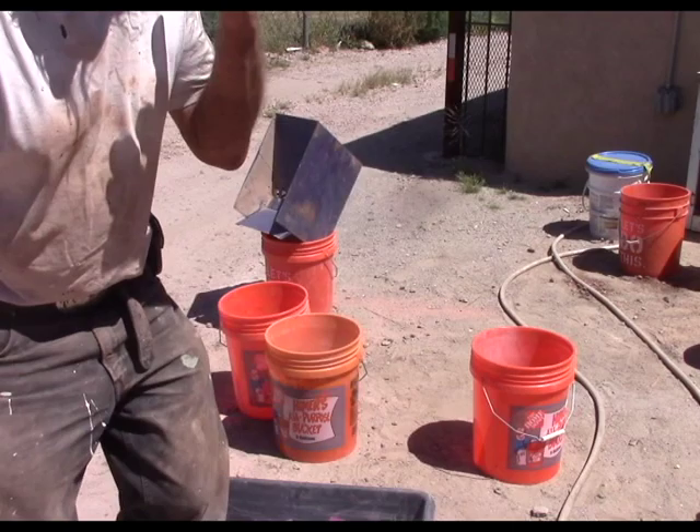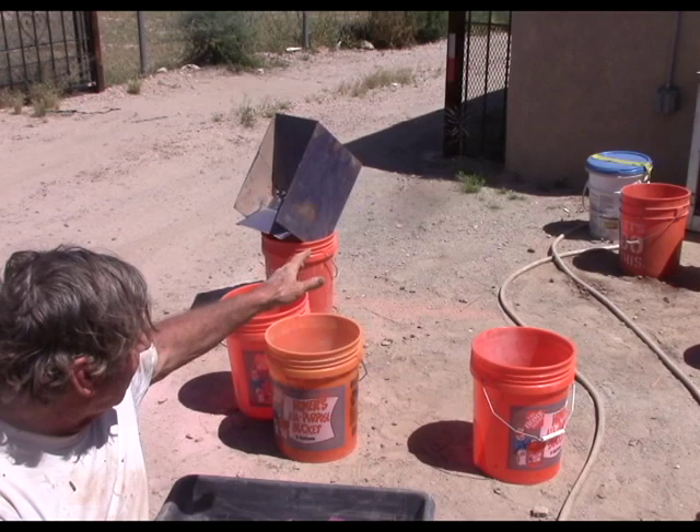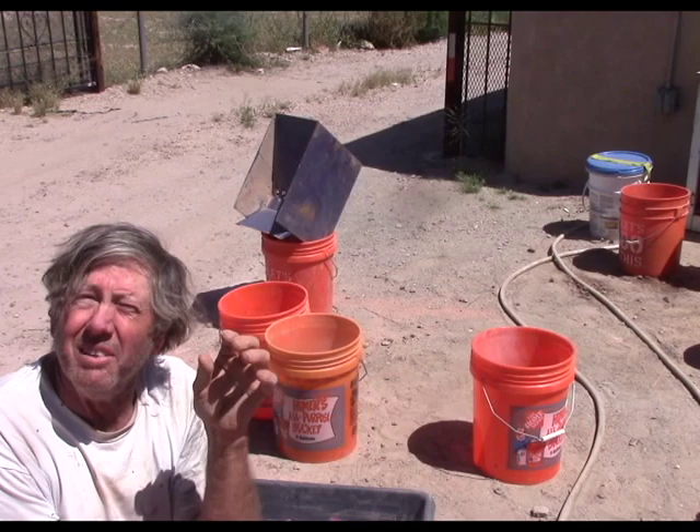I have now representatively turned about a 35-pound sample into about a 1 or 2 pound sample in a representative manner, just that fast. That's the advantage of the sample splitter.